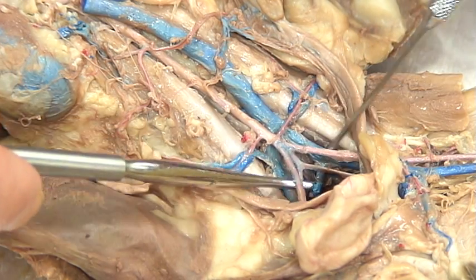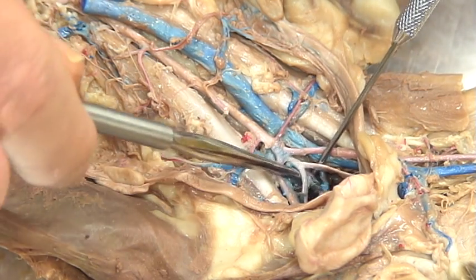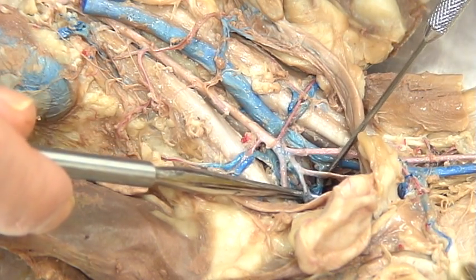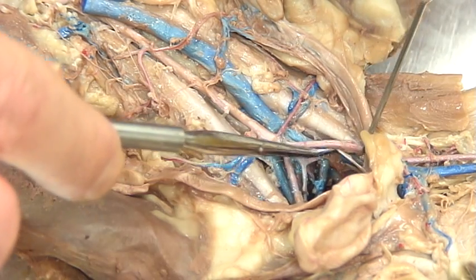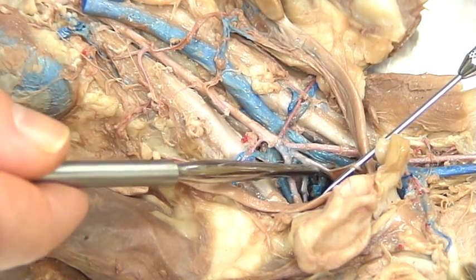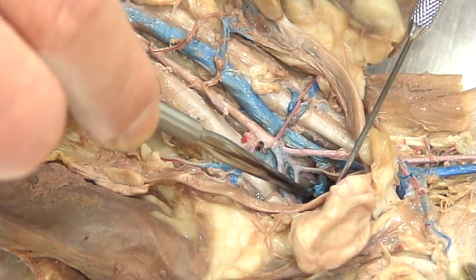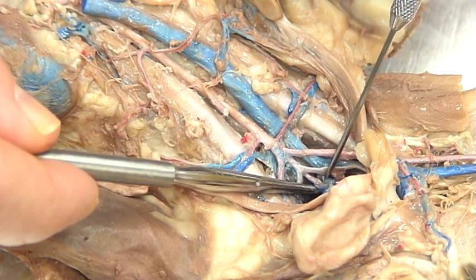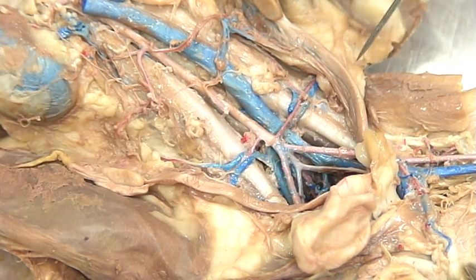This first branch is going to be the external iliac, which goes right into the leg — we'll follow that down a little bit more later. The inside one is the internal iliac, and what the internal iliac is going to do is branch again into the superior and inferior gluteals, which are a little bit trickier to see. Here's the superior and here's the inferior gluteals, and it'll actually continue straight down into a caudal artery, which will feed into the tail.